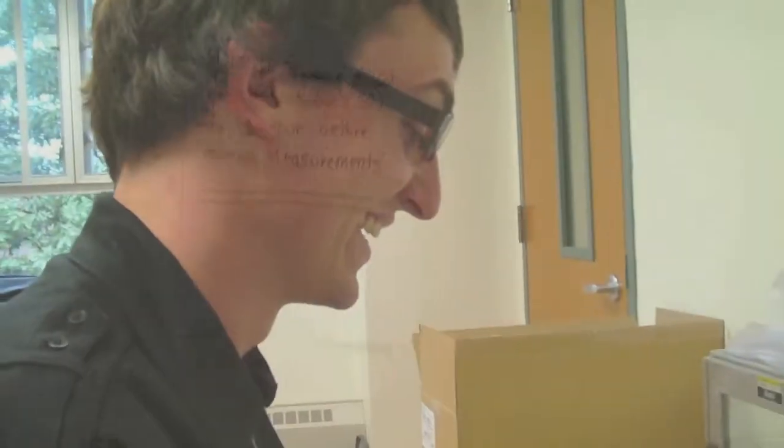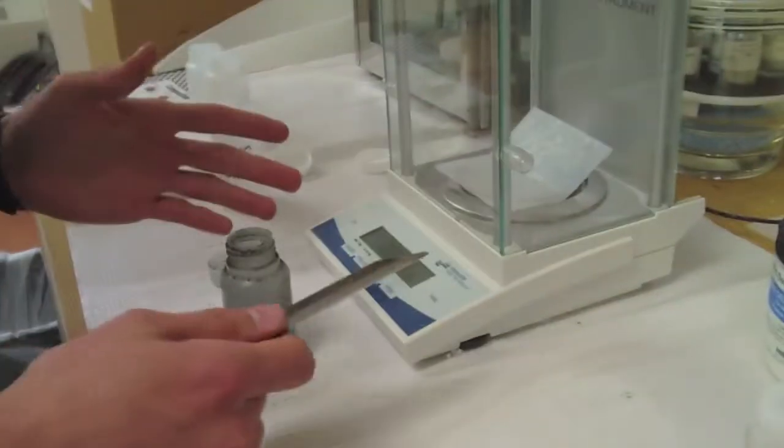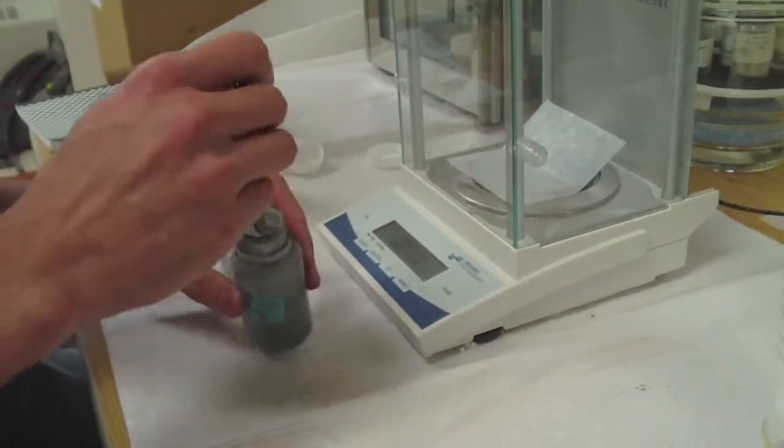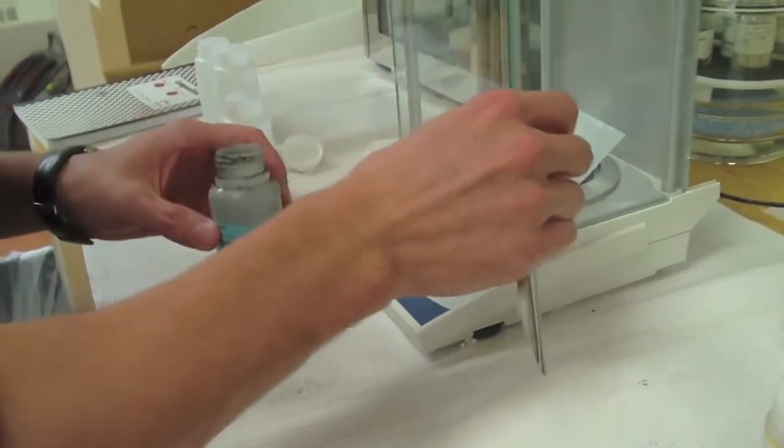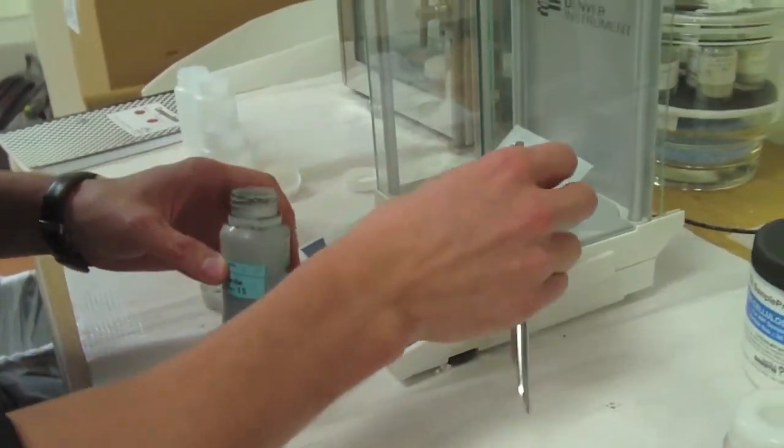Okay, we'll get back to you with step two. Okay, this is step A of step one. We have to measure out seven grams of each sample onto this little thing and then I'll do the rest later. That's scientific sounding.